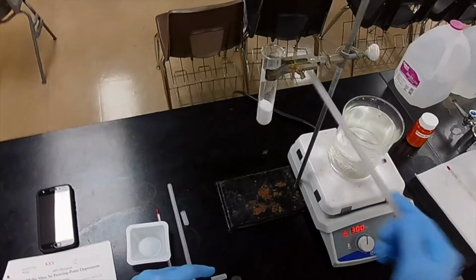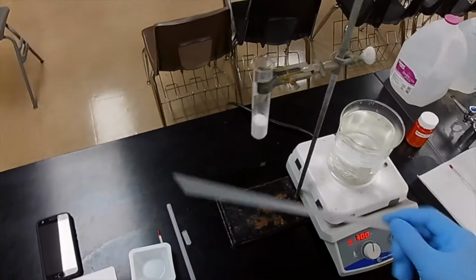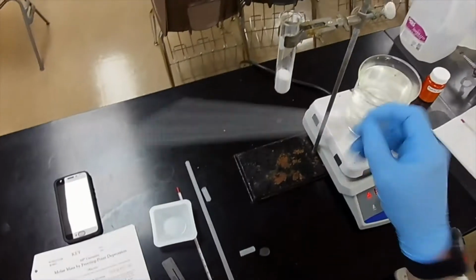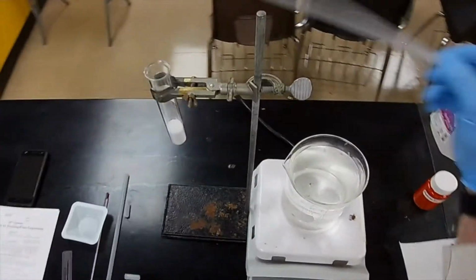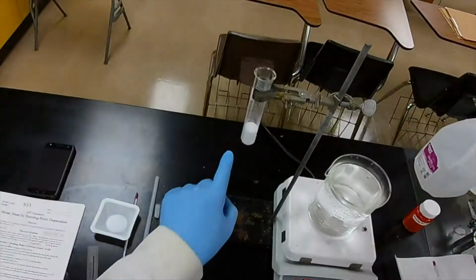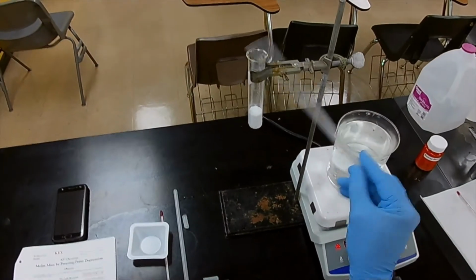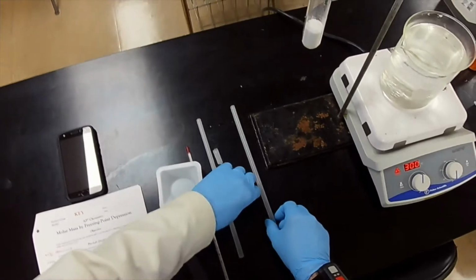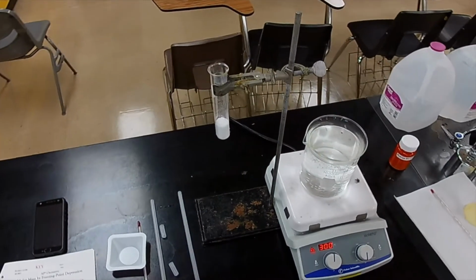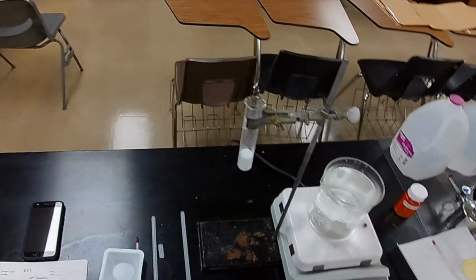All right. So notice that there is some stuck to the walls. Now the less of that you have, the better. That's going to bias our results. That's called experimental error. We think we have 8.057 grams down in the bottom, melting in the hot water, but actually we have less. So what does that do to the concentration? If the denominator, which is the solvent, is less than we think it is, then the concentration of the solute later is actually higher than we think it is.